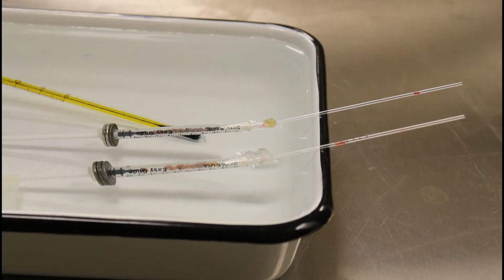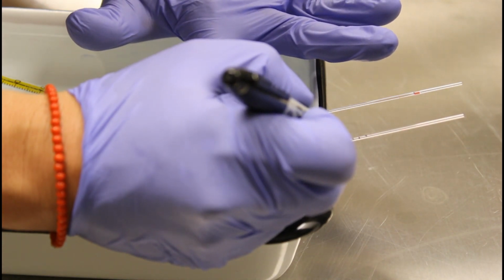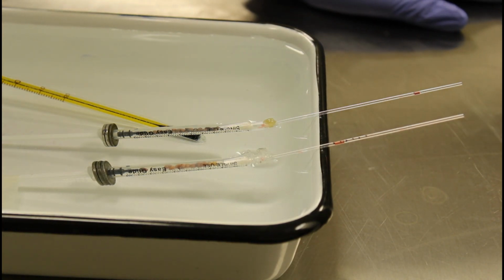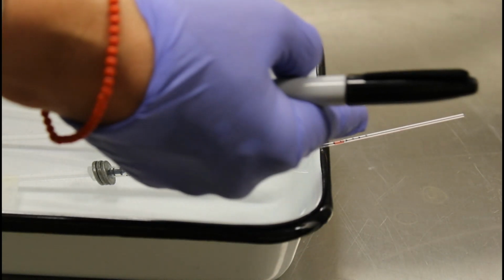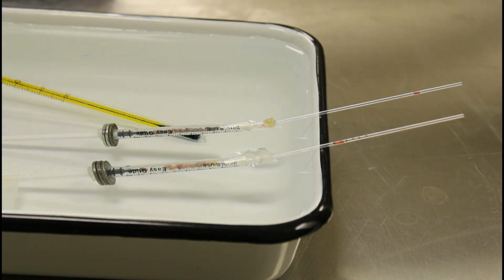Okay, so it has now been 25 minutes since we first put the manometer fluid in the capillary tube. So I'm going to go ahead and make our final mark. I still see no movement in our control syringe. So we are going to take a picture of both of these setups, and we're going to take a picture of it next to a ruler so that you can actually calculate the rate of respiration that was occurring. So how much gas, oxygen specifically, was being absorbed per minute in our micro respirometer.